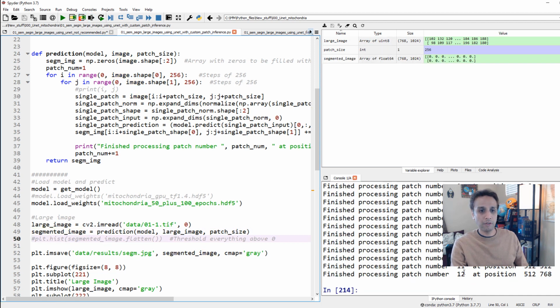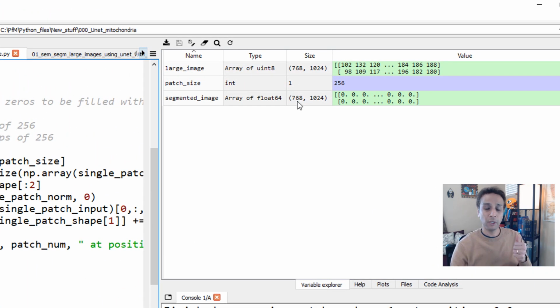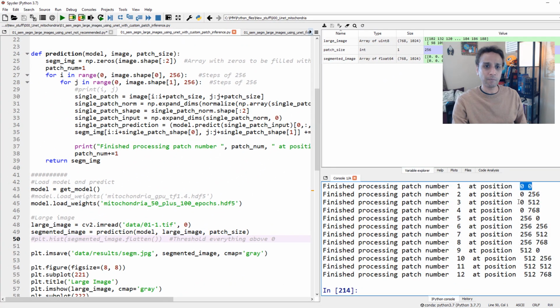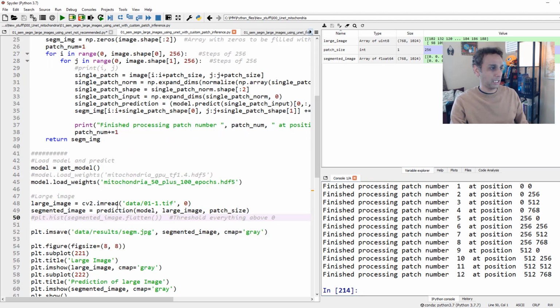So patch number total, I have 12 patches. If you think about this, 768 divided by 256 is 3. 1024 divided by 256 is 4. So I have 3 by 4 patches, which is 12. So the math works out. That's a good sanity check. And you can see where it's starting at 0, 0, then 0, 256, 0, 512, and 0, 768. And then it moves on to 256 and then 512. So everything is fine now, right? So that's pretty much it.